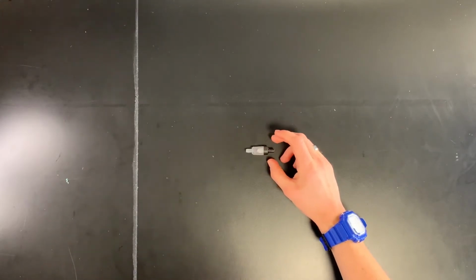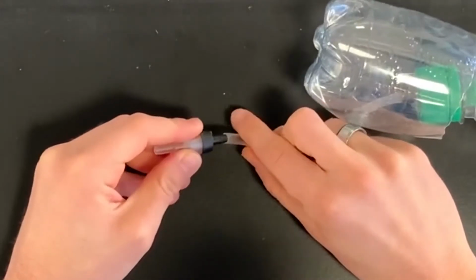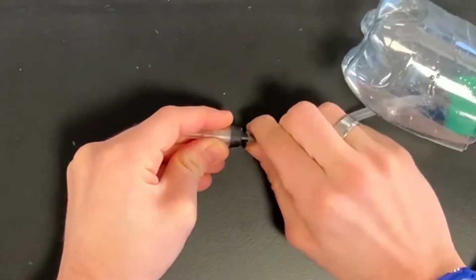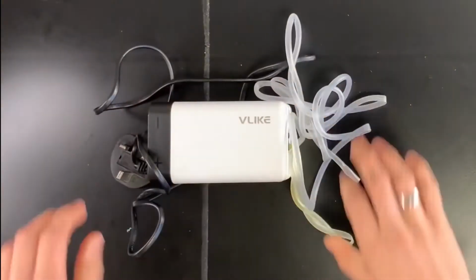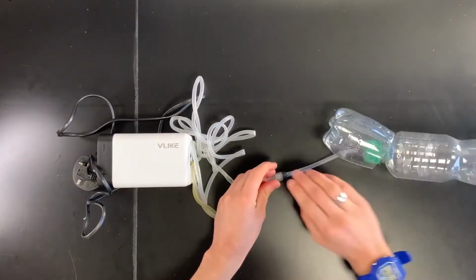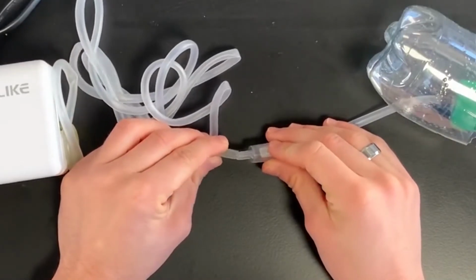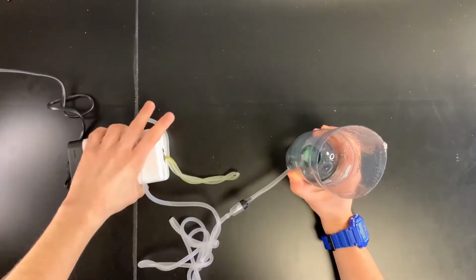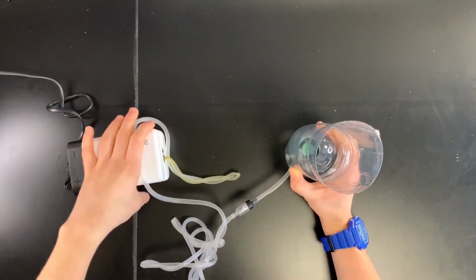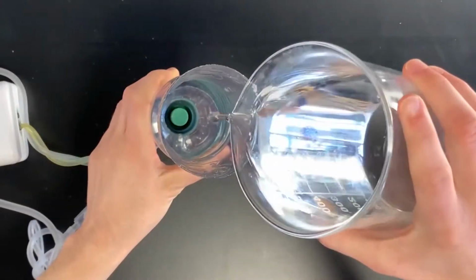Then take our one-way valve and we're going to fix it on to the end of the rubber tubing, like so. Then we take our air pump and our hatchery and we're going to attach the end of the rubber tubing onto the other end of the one-way valve, like so. Now that we have our hatchery assembled, it's time to start filling it up. So the first thing we do is fill up our hatchery with water.